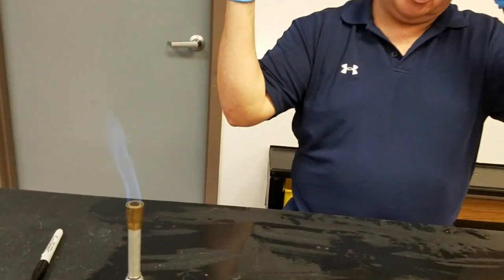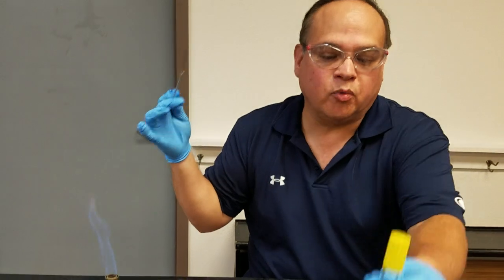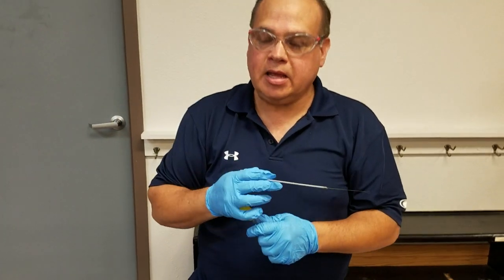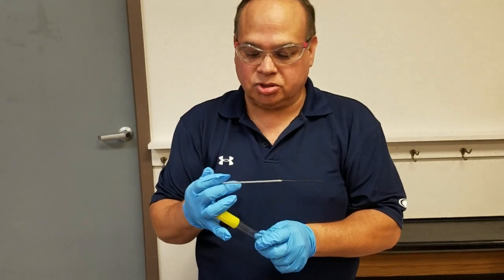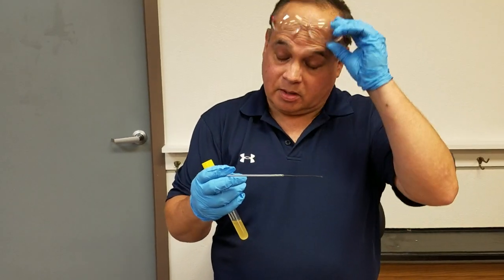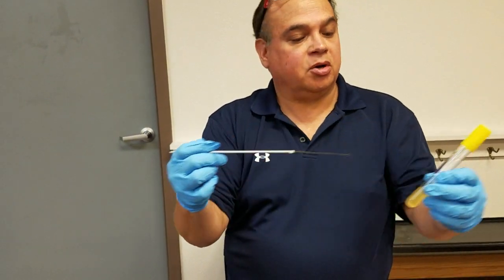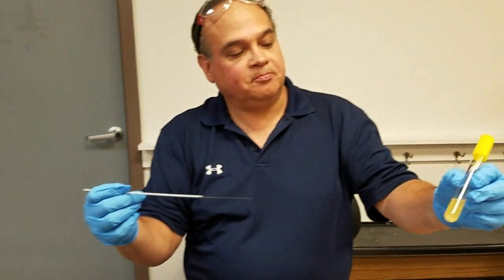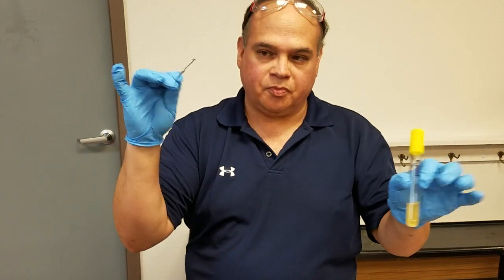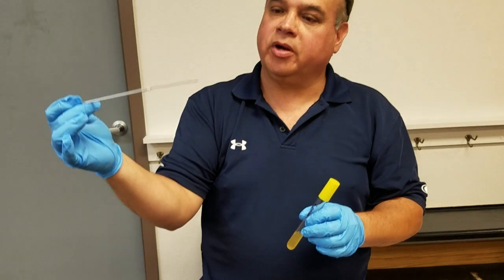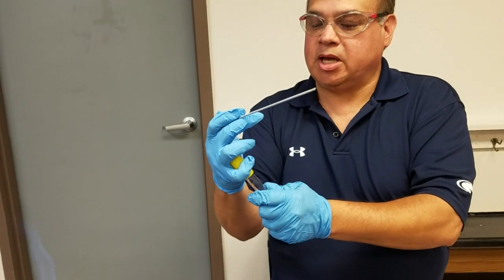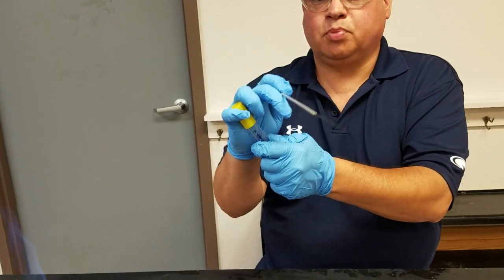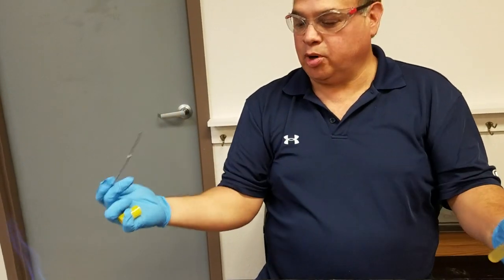This is still very warm, so be careful when you stick it into anything with microbes that you don't create an aerosol. Here's the organism and here's the loop, as clean as I'm going to get it. Take the pinky, pull up on this, never put anything down. I'm going to waft the tube in the flame.